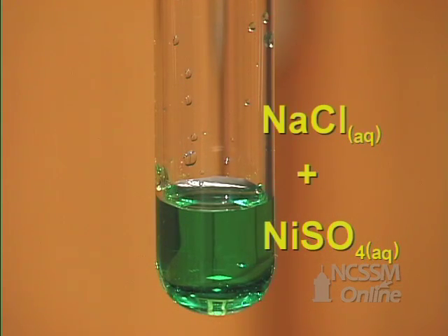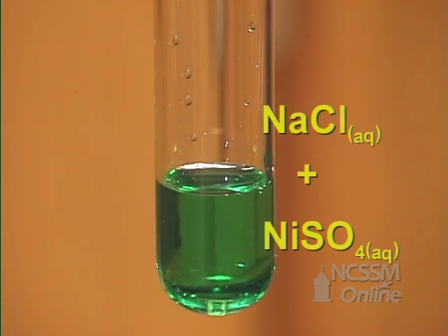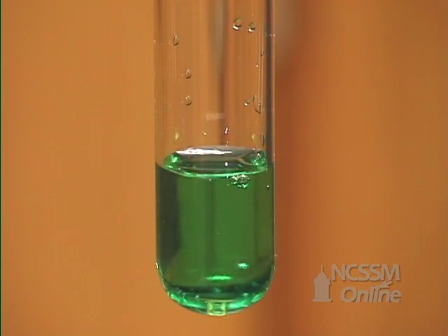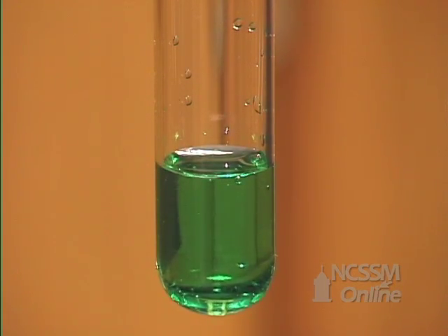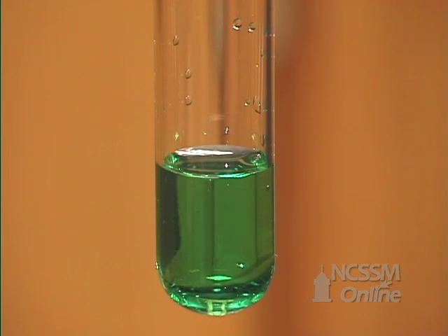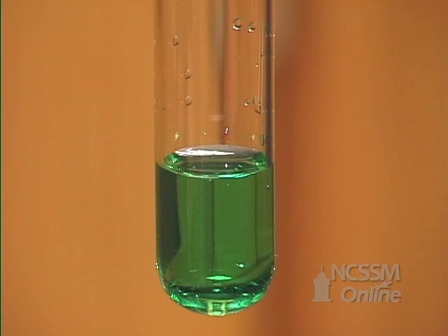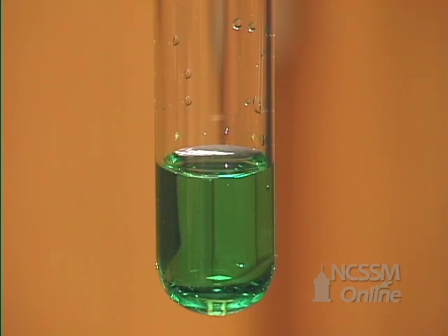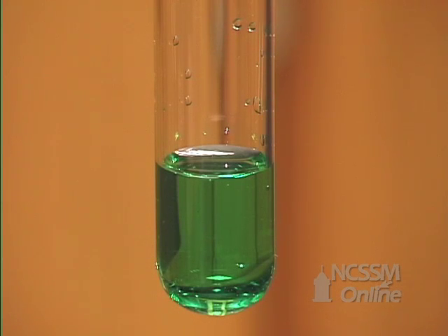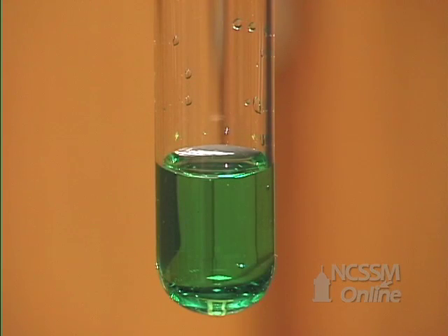The sodium chloride and the nickel sulfate are water soluble. The potential products, nickel chloride and sodium sulfate, are also soluble. What we end up with is a solution that contains nickel ions, chloride ions, sodium ions, and sulfate ions in aqueous solution. No precipitate is formed. No reaction occurs.